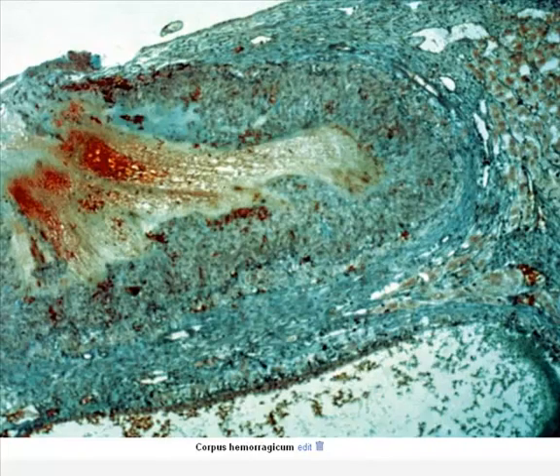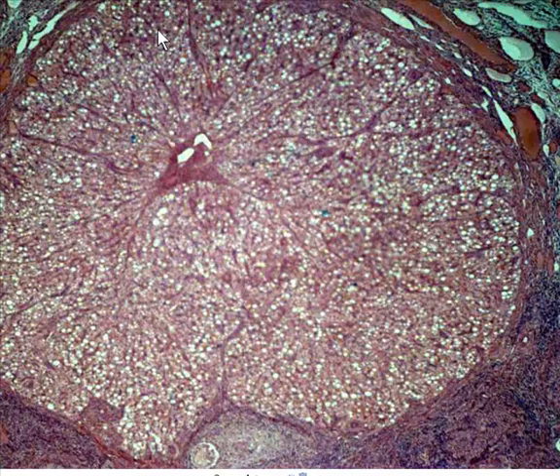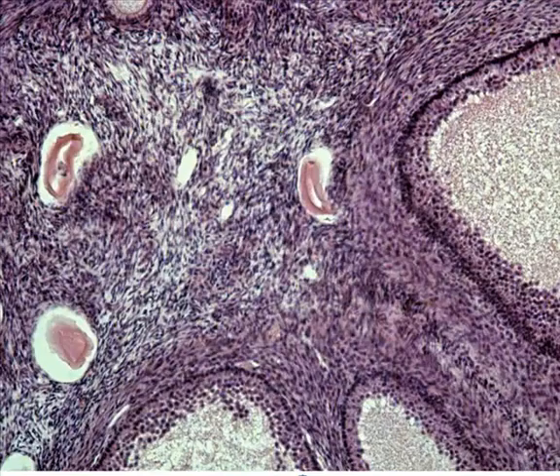This is a corpus hemorrhagicum that we see here with the blood on the inside. I haven't seen too many of these in the slide, so I wouldn't worry about identifying them in the slide. This whole structure here is a corpus luteum. So a solid ball of cells, like we said, that secretes progesterone in order to maintain the uterine lining. And some atretic follicles again.